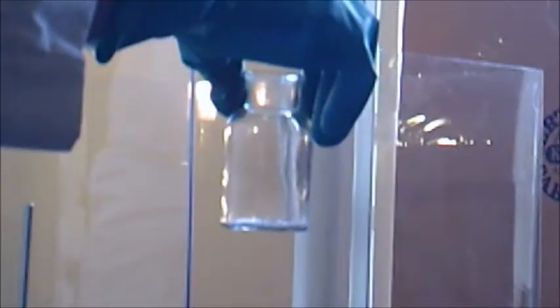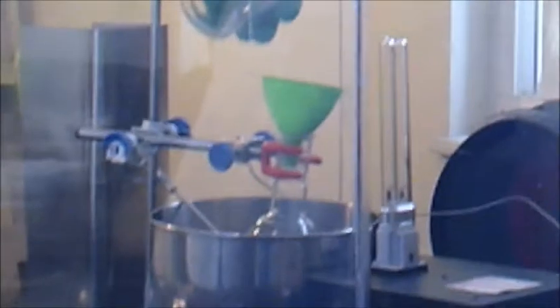Okay so let's begin. First off we're going to add two grams of sodium pyrophosphate using the funnel to a hundred milliliter round bottom flask. And this is a special quartz flask which allows the penetration of UV light which will be used in the experiment. So there's our sodium pyrophosphate.